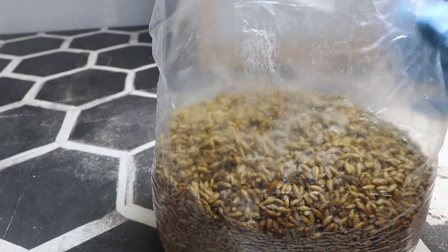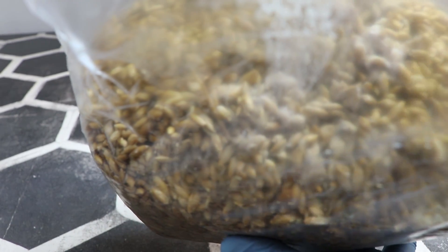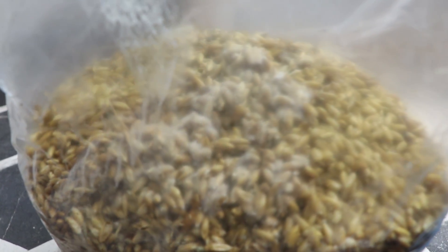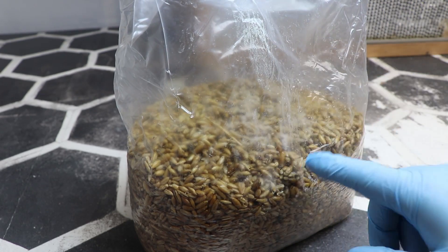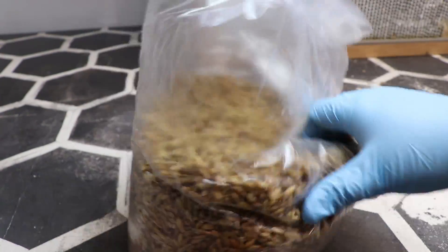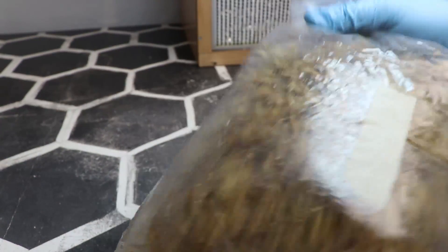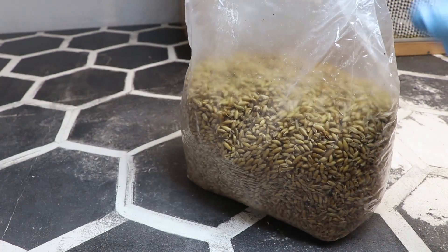Put the light on there — let's see if you guys can see it. That flare is pretty bad. All that white growth on the top — that is all mycelium that is growing off of the liquid culture I got from Lenny. Now, all I'm going to do, now that it's grown multiple grains deep and connected into a web, is break all of that up and shake it up. That'll be completely grown in about three or four days from now.